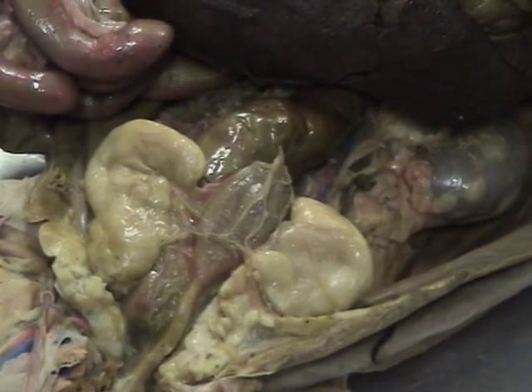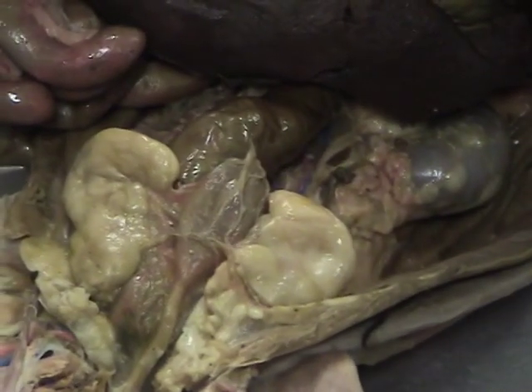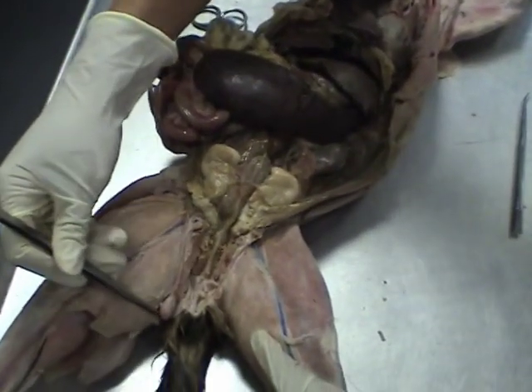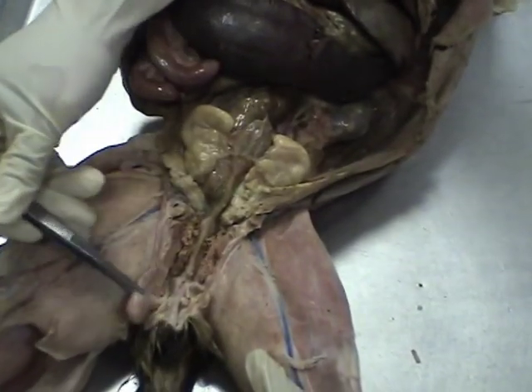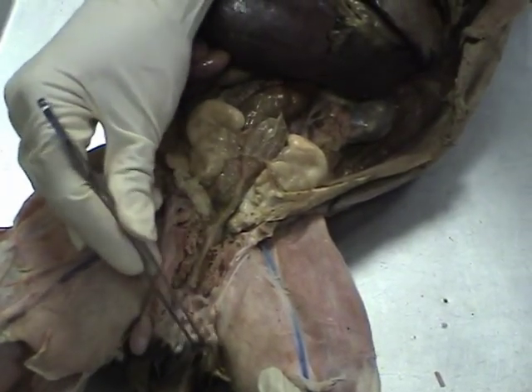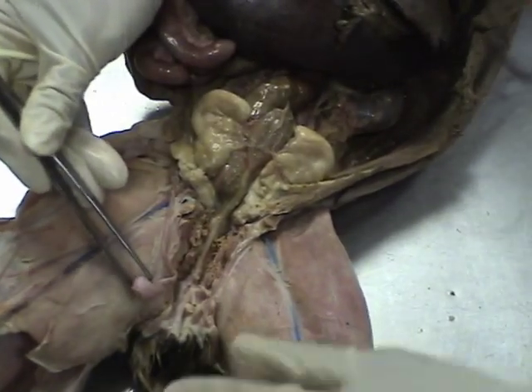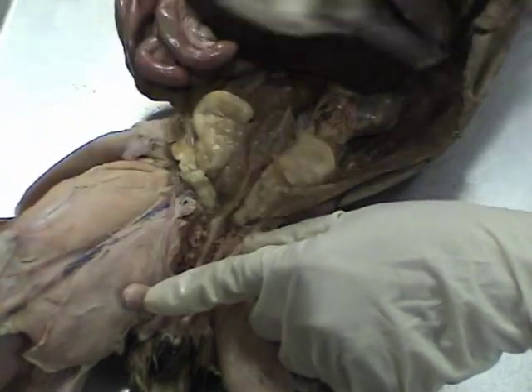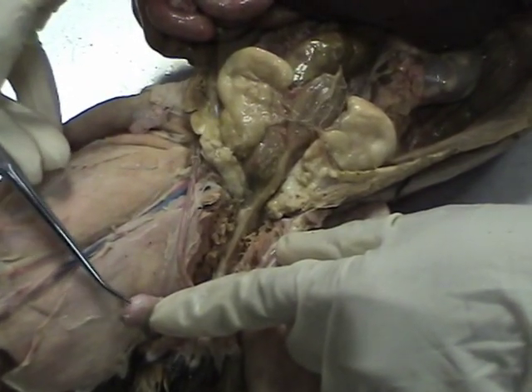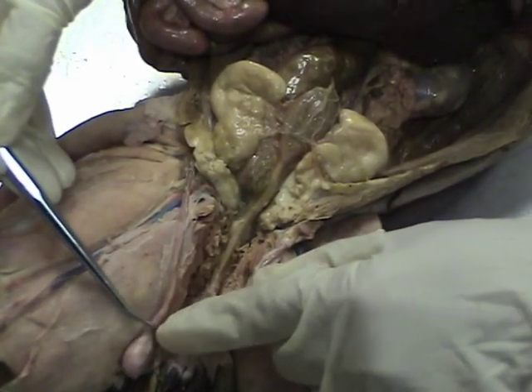Because this is a male cat, we're going to talk about the male reproductive tract. On your list, number 31 is the testes. Coming down between the legs, out by the tail, you see this round structure — that would be the testes on the right side. The left side is still in the testicular sac, so it hasn't been pulled out yet. In addition to knowing the testes, you want to know the epididymis. The epididymis is a small region just right here — the head of the epididymis is here, it curves on the bottom and kind of hangs onto the testes, then goes on up.